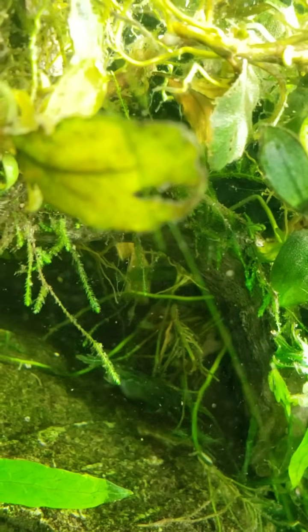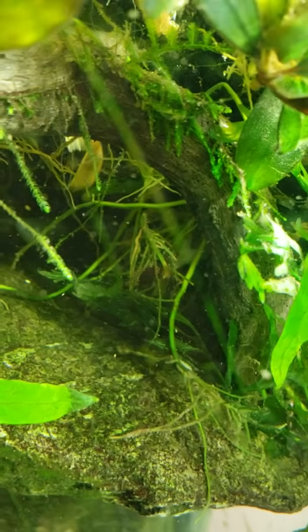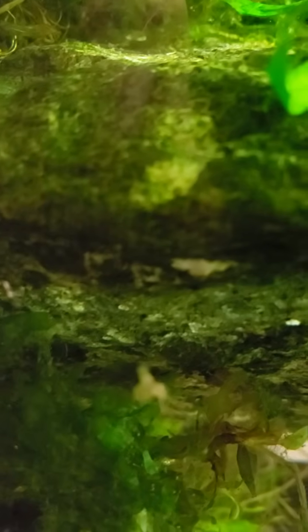But let's see here, can we see any of these little things floating past? Hold on one sec. I had some fish food, and it always shows the current. Maybe we can see it here. But there's actually a current in these little flaky guys that comes through. And here, you can see it coming around the corner really slowly. But I think that slow, continuous current is exactly what has allowed these sponges to take hold and enjoy this area.